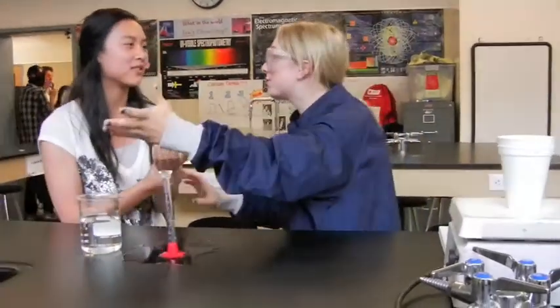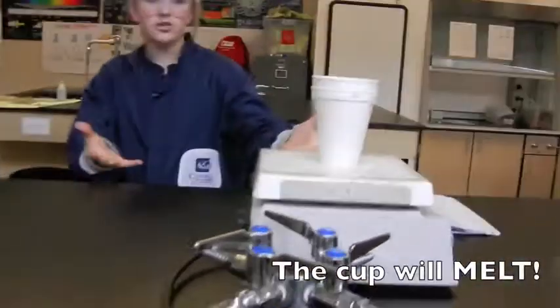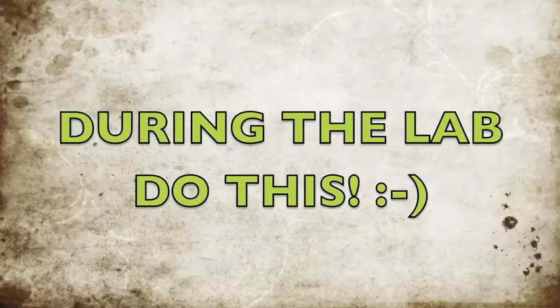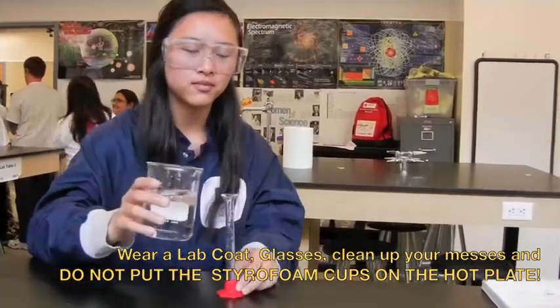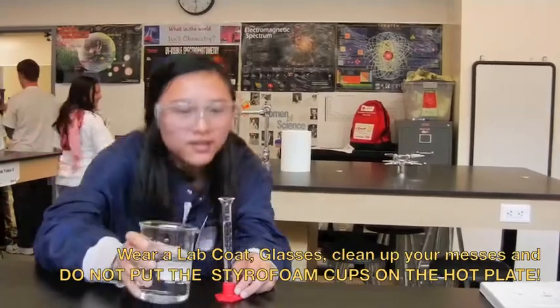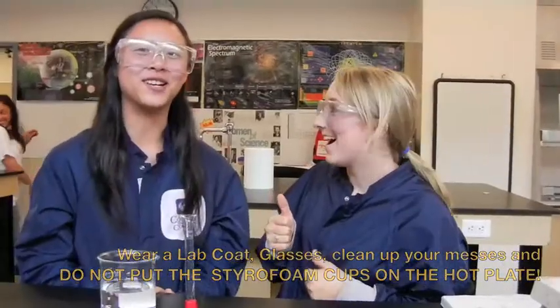It burns. You need to rinse your hand in the faucet, and you're not wearing glasses, and you're not wearing a lab coat. You're not even cleaning up your mess, and you have a styrofoam cup on the heater. I think I'm gonna go clean it. Yes, please do. Here's another beaker of acid. I think I'm going to measure it. Good job, Kathy. I'm so proud of myself.